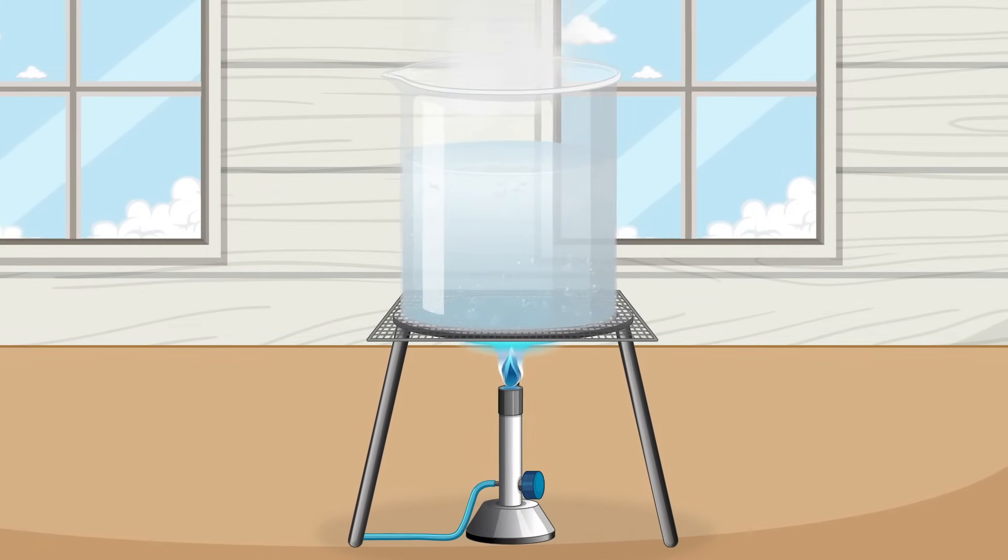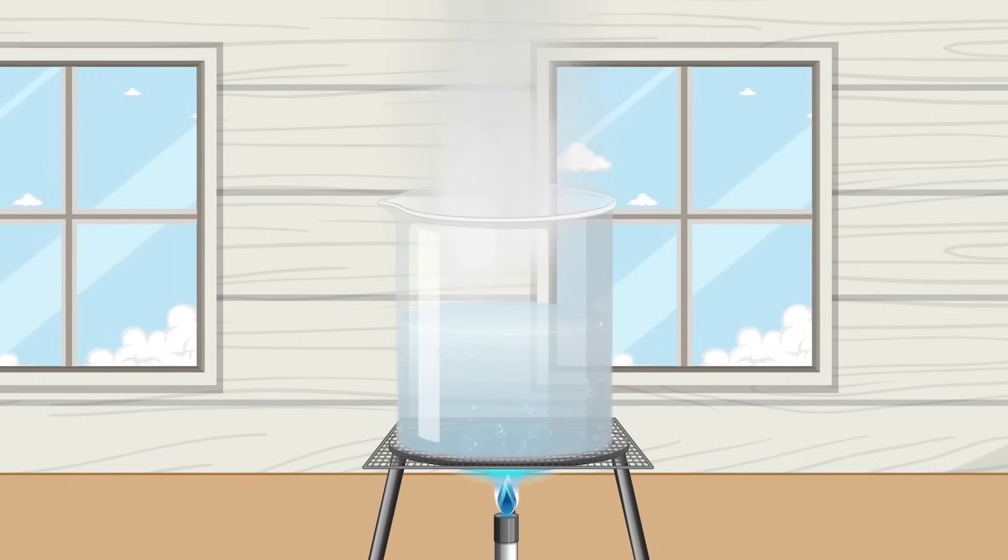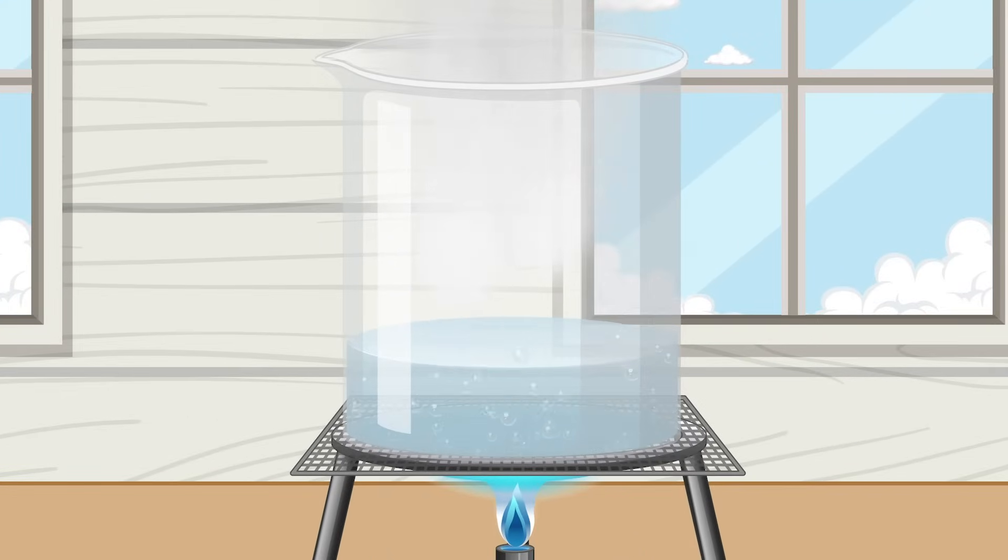This causes the solvent portion, the liquid water, to change its state from a liquid to a gas called water vapor, a process called evaporation. Notice the level of water decreasing as more and more water evaporates into the air.